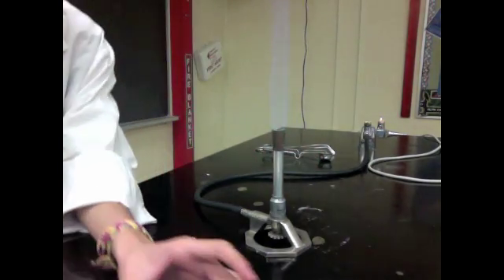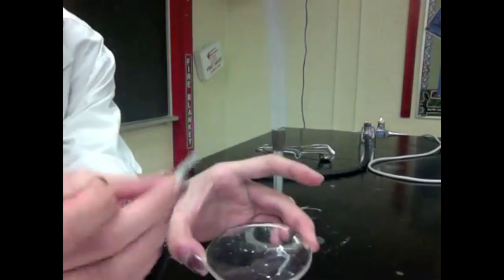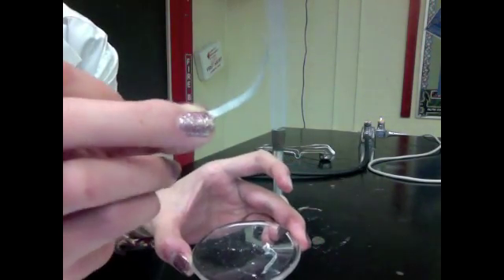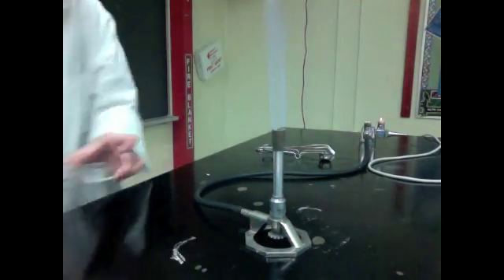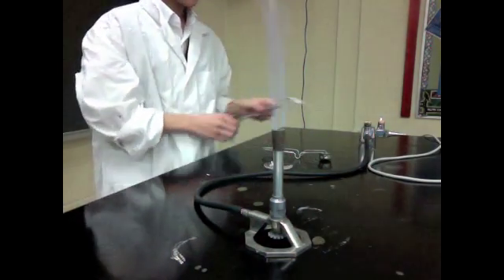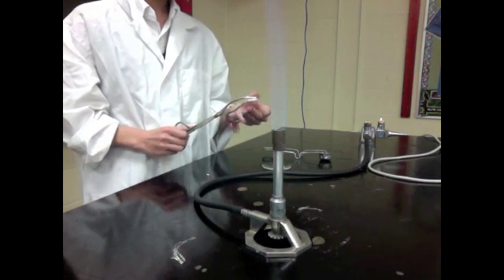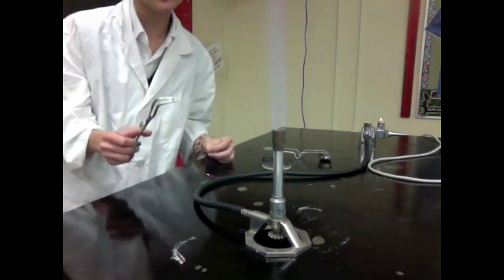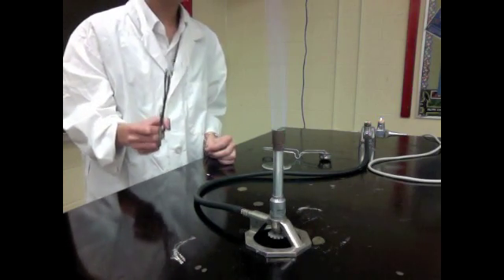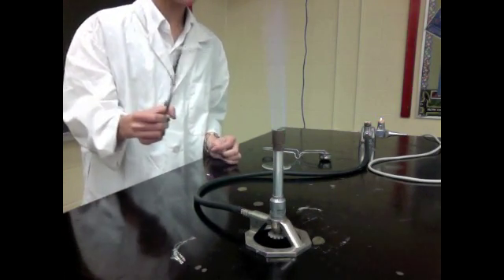So here's the magnesium ribbon. It looks like this, it's just a piece of ribbon. We're going to pick it up with our tongs and we're going to put it over the hottest part of the flame. Be careful not to stare at it too intensely because this may hurt your eyes.